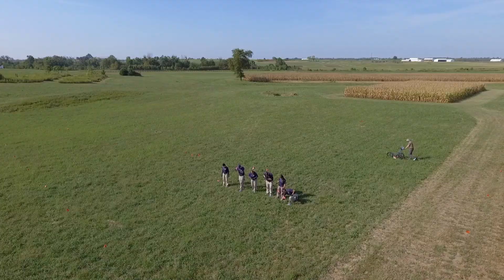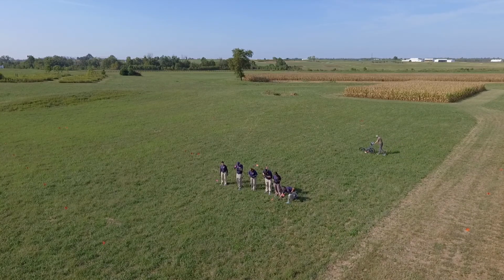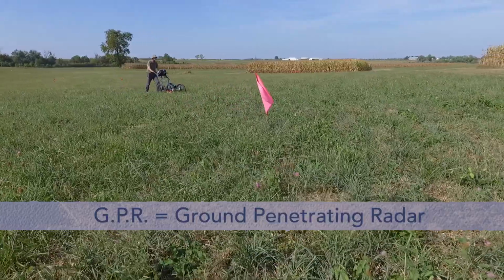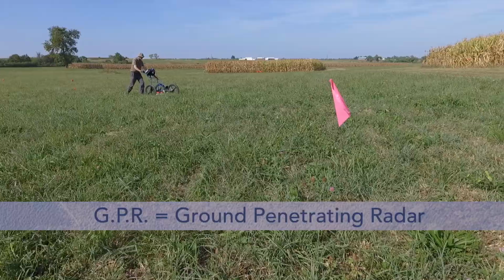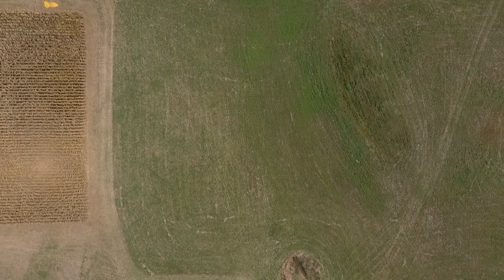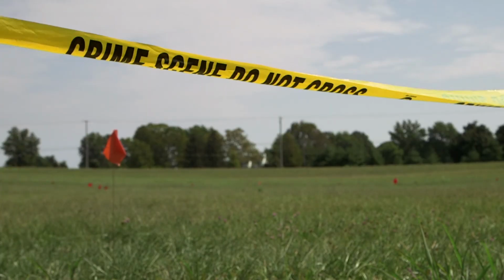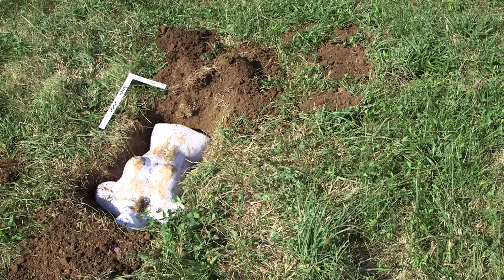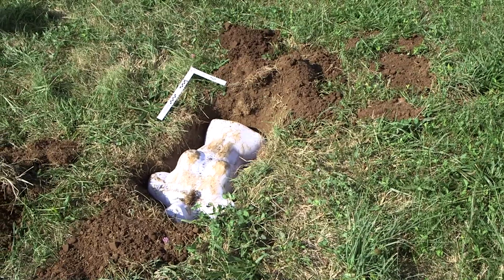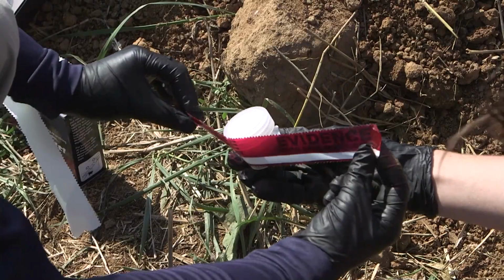Independent, but allied to these ground searches, is the deployment of geophysics, such as GPR, as seen here. Metal detection and other methods may be used. Together, soil disturbance, the vegetation changes, geophysics, and indications from cadaver dogs after probing, these are not shown, enable a decision on whether to forensically excavate, which will expose any buried objects, and the soil profiles needing sampled as in this video.